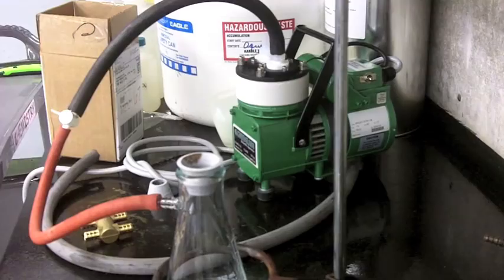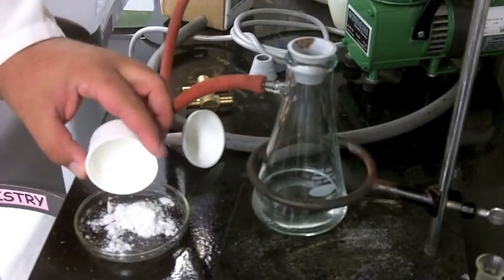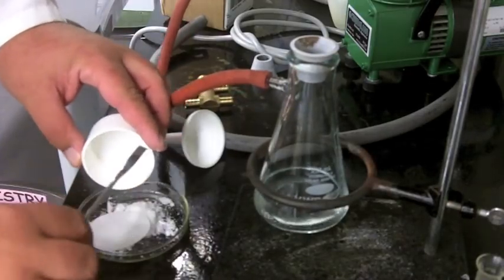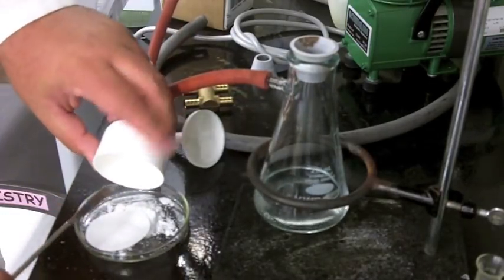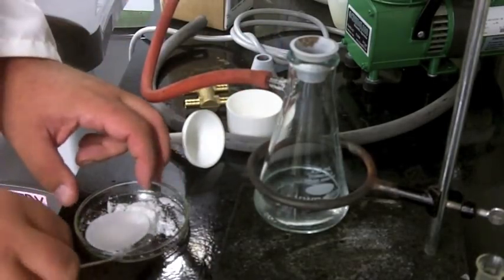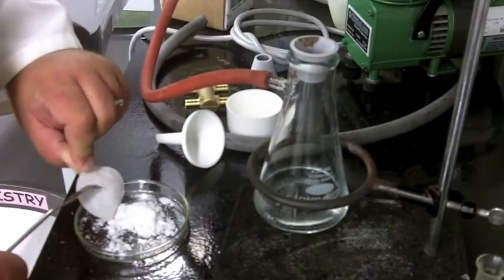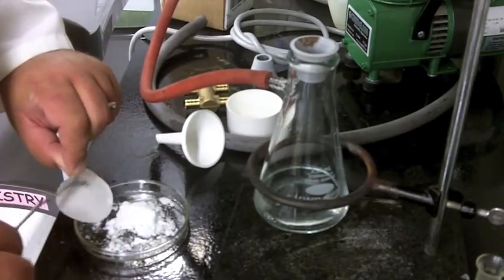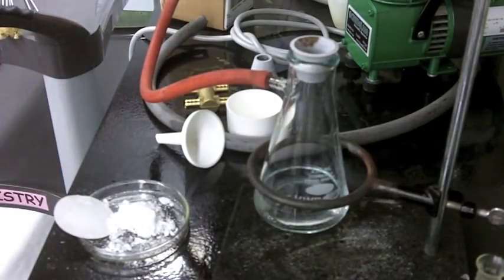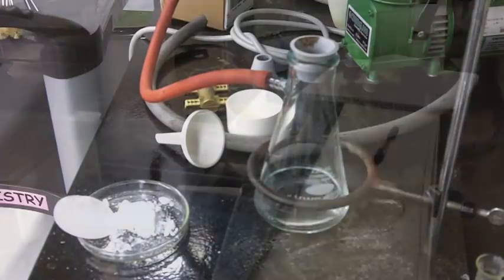The solid will still be a little wet, so you're probably going to overestimate your mass a little bit — but it's enough that we can live with it. Ideally we'd let it sit for a week and dry, but it's kind of a pain, especially this late in the lab season. Just measure the mass. If you want, you can pre-weigh the filter paper and scrape the solid off. I would wear gloves — not wearing gloves is sort of a bad idea.